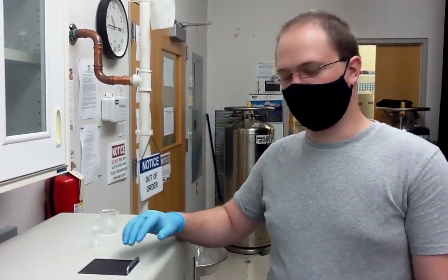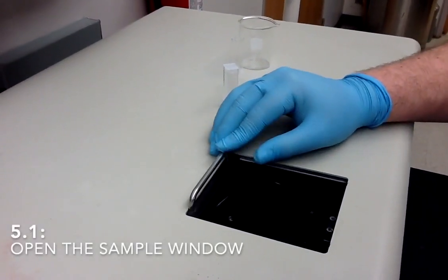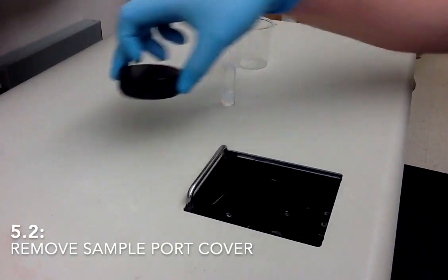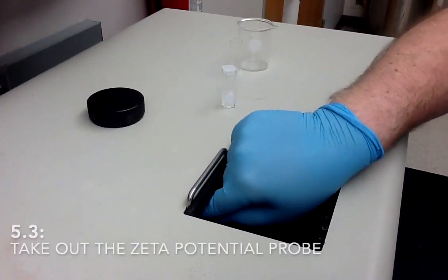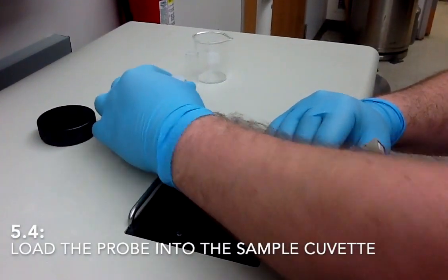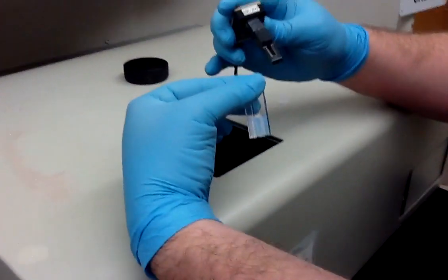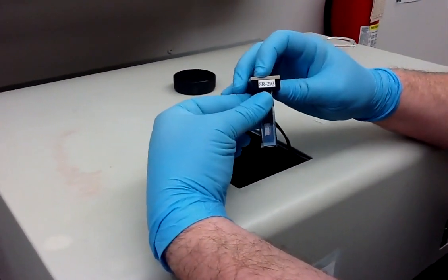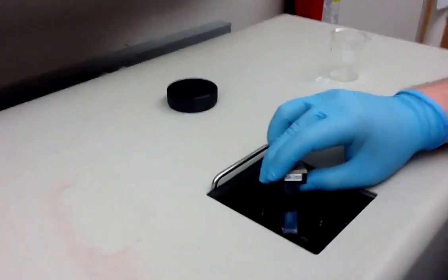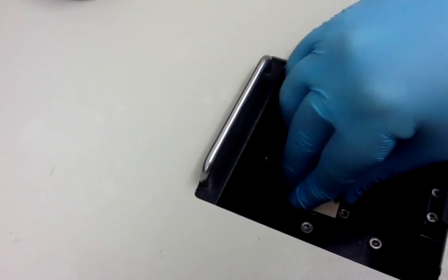If you need to do a zeta potential measurement, you will load your sample slightly differently versus the particle size. First, you will open the sample window and remove the dust cover. Then, tucked underneath is the zeta potential probe. You will load the probe into your cuvette, and then load the cuvette into the sample window.